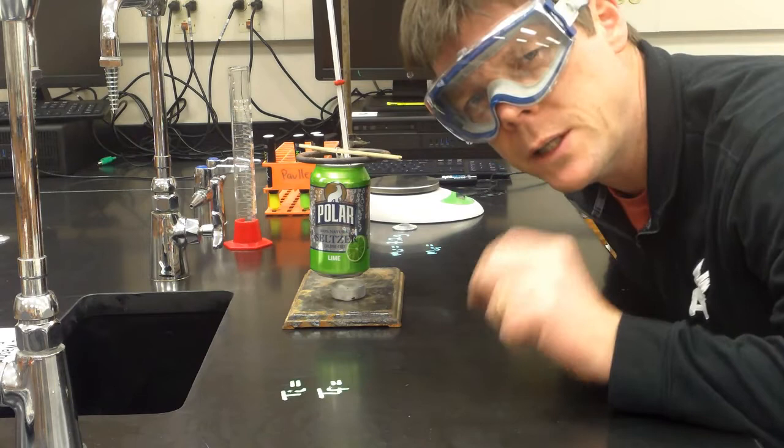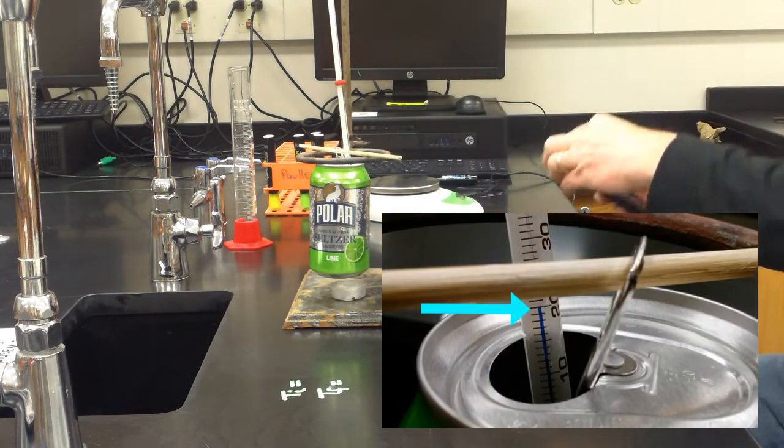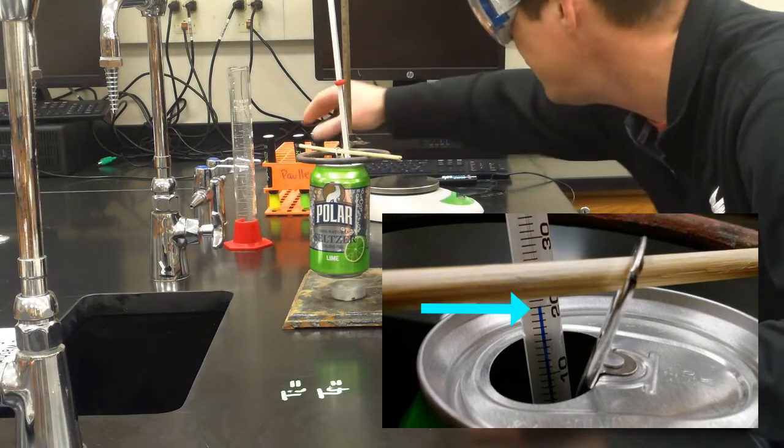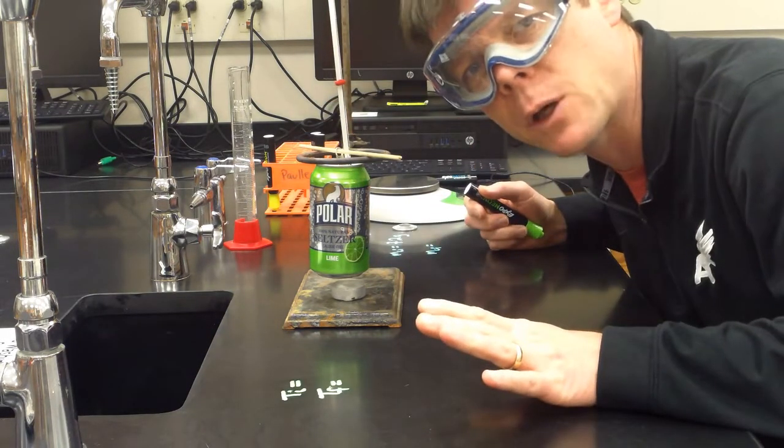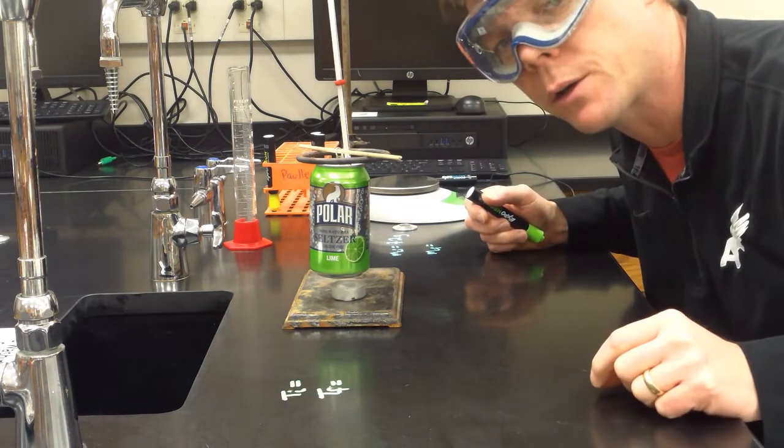It looks like the temperature is 20.0 degrees. Alright, so it was a temperature of 20.0 degrees. I'm going to go ahead and record that for the starting temperature of the water, the TI.